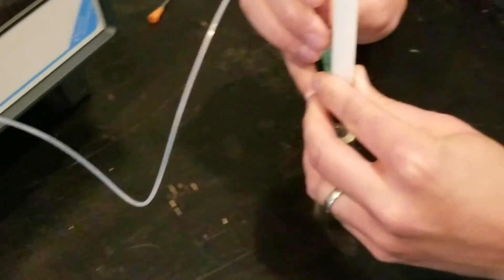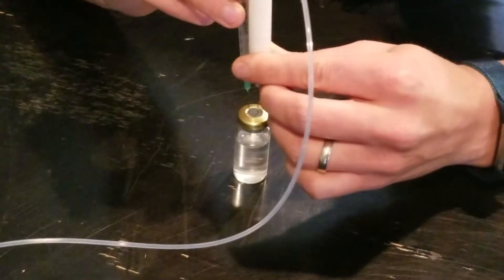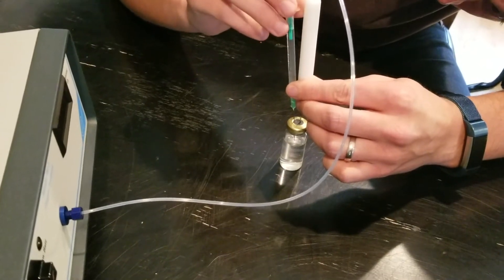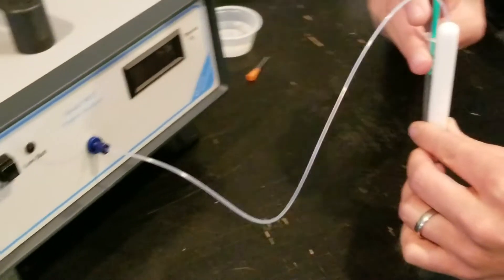With my other hand, I'm going to puncture this one through with the water. This one it's okay if we go down towards the product because we're going to be slowly injecting the water in. To start, I'm just going to put 0.2 cc's of water in.